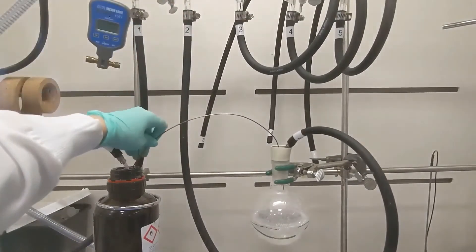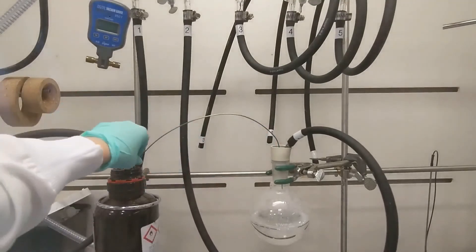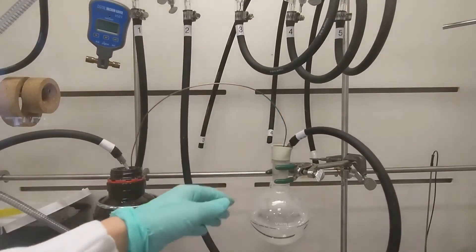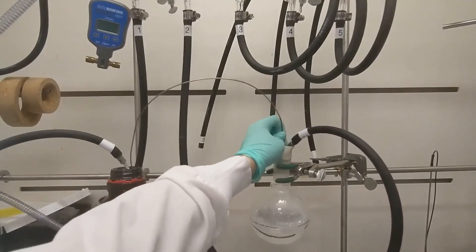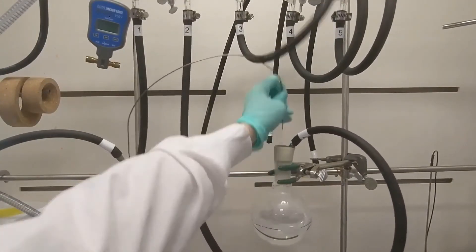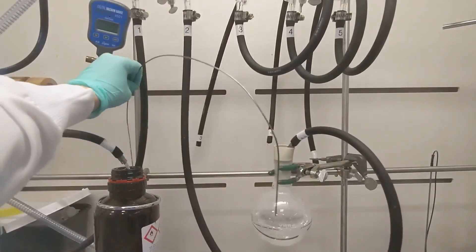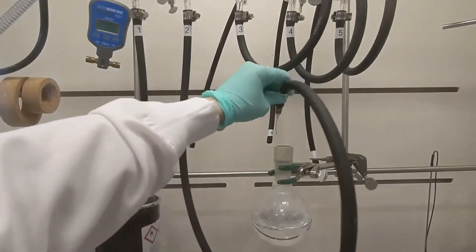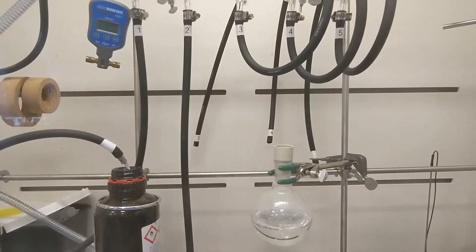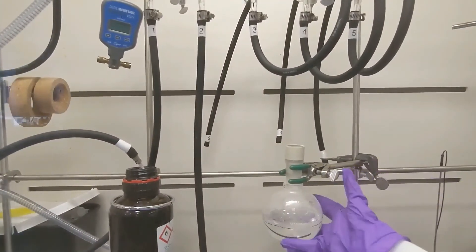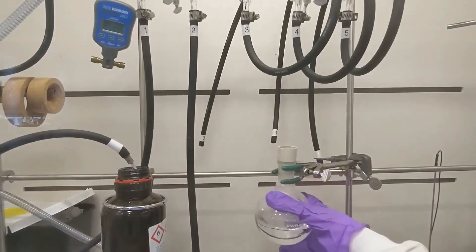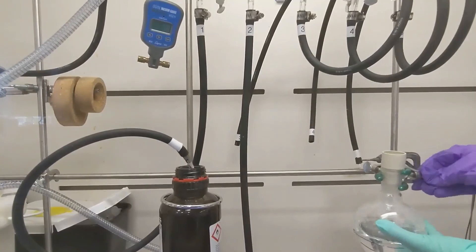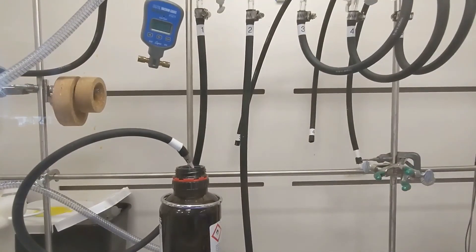When I showed this video to my coworker, he asked me why I was only using one hand, and this is the reason why. Using both hands is much safer than using one hand, so please, if you're watching this and you have both hands, please use both hands to hold things, clamp things, and just do things in the lab in general. The only exception to this rule is the super cool chemist I met who only had one functional hand but still managed research and graduated with a degree in chemistry. They are, I think, the only person I would trust doing one-handed chemistry safely.